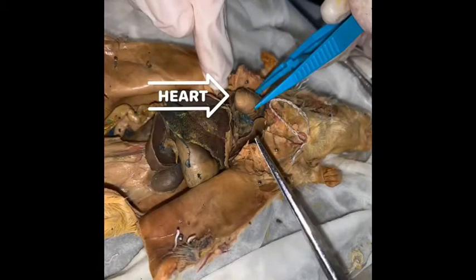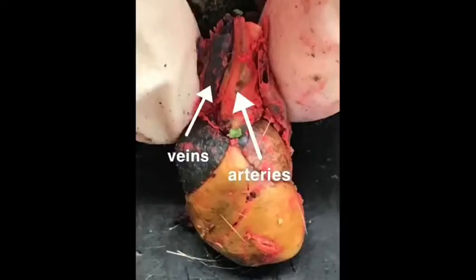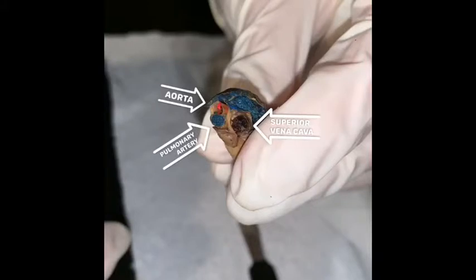Now to start off, we're going to be talking about the circulatory system, which involves the heart, veins, and arteries of the rat. Veins, which are the blue tubes, are used to carry deoxygenated blood back to the heart and lungs. Arteries, which are the red tubes, carry oxygenated blood to the muscles and organs that need it. The heart is covered in a thin, tough membrane called the pericardium.